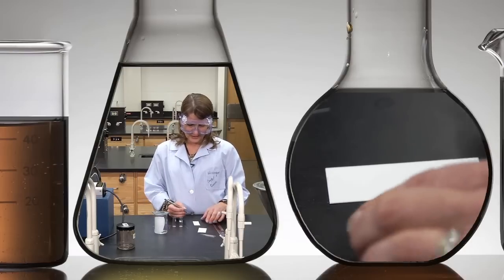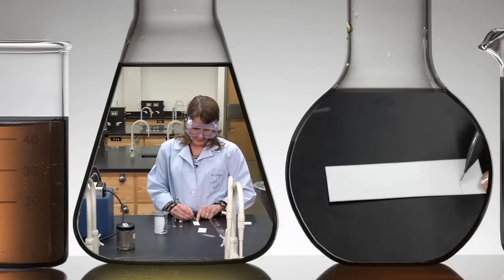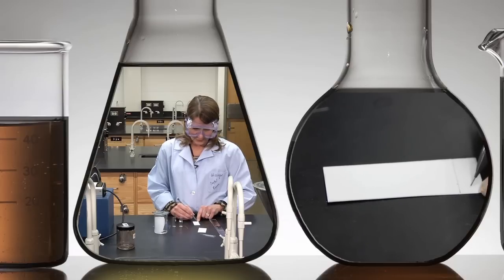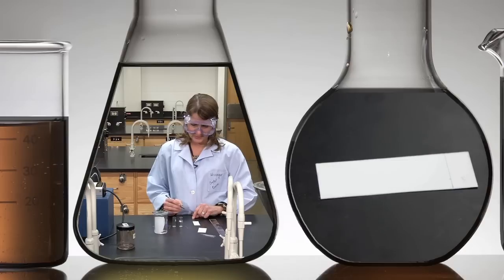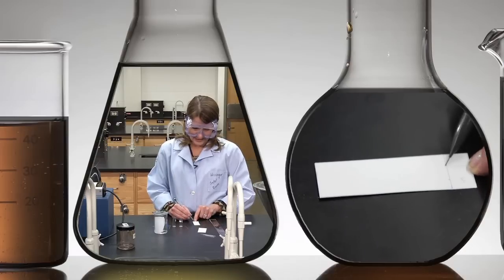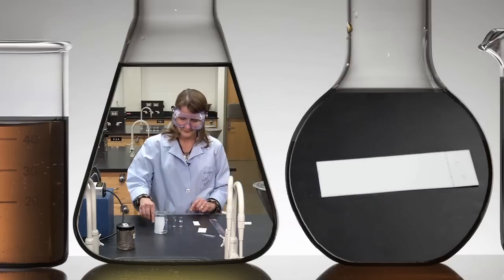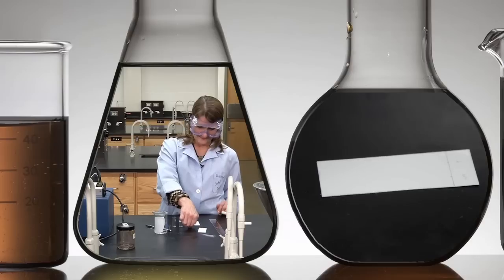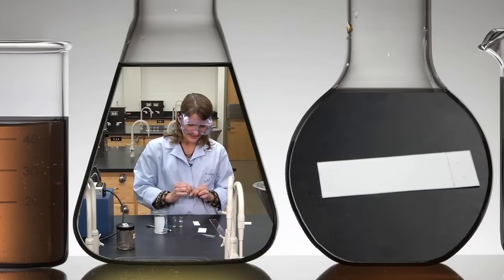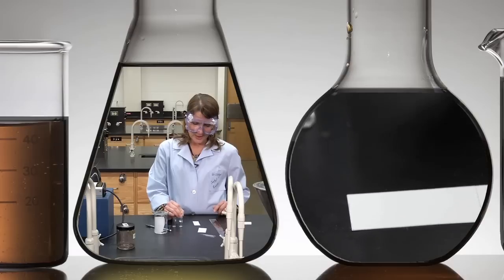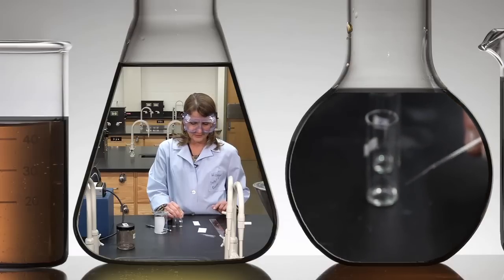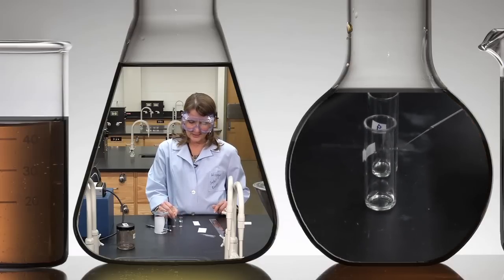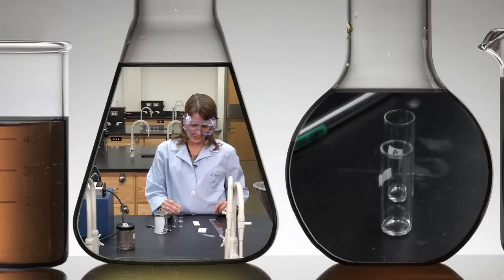I'm now ready to spot and I'm going to make a little mark and identify this as starting material and another as product. You've already pulled the capillaries, and you've dissolved a small amount of the starting material in solvent as well as the product from the reaction in a solvent.